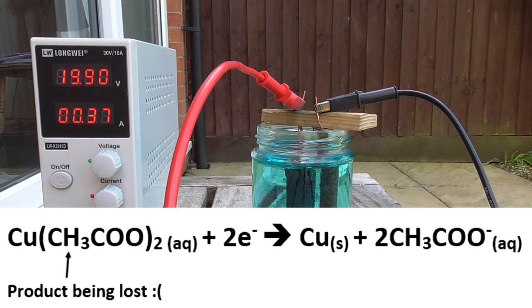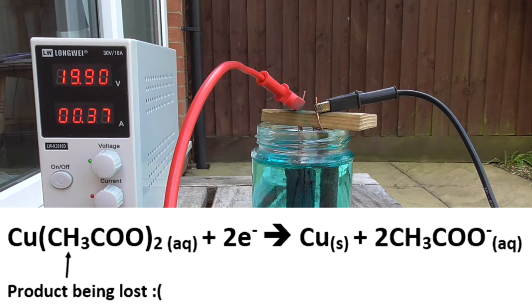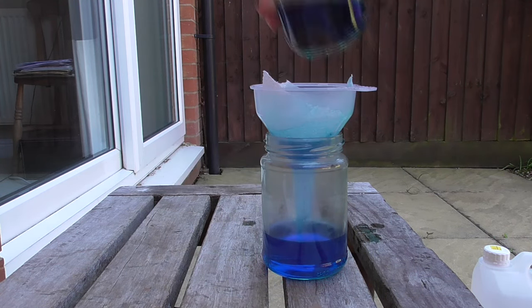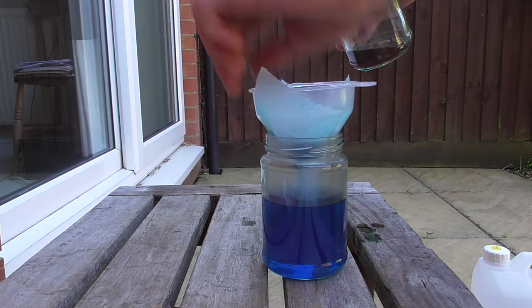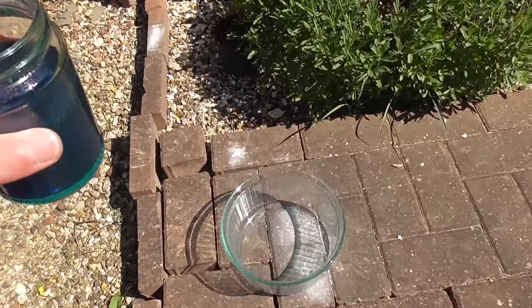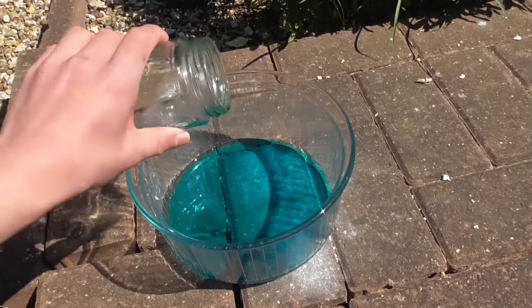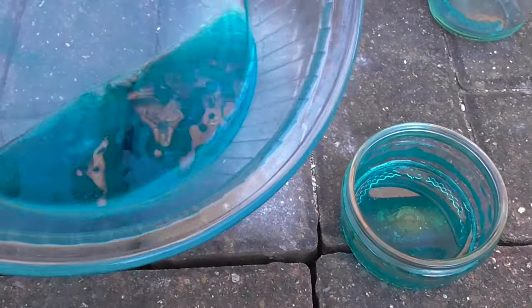So at the end of the reaction, we do have some copper acetate. However, some of that copper acetate will be reduced back into copper metal, which collects at the cathode. After the electrolysis, we filter off the copper powder and then leave the solution out in the sun to evaporate. It's been a while — the latest batch — some of it has evaporated and there are some crystals floating about.